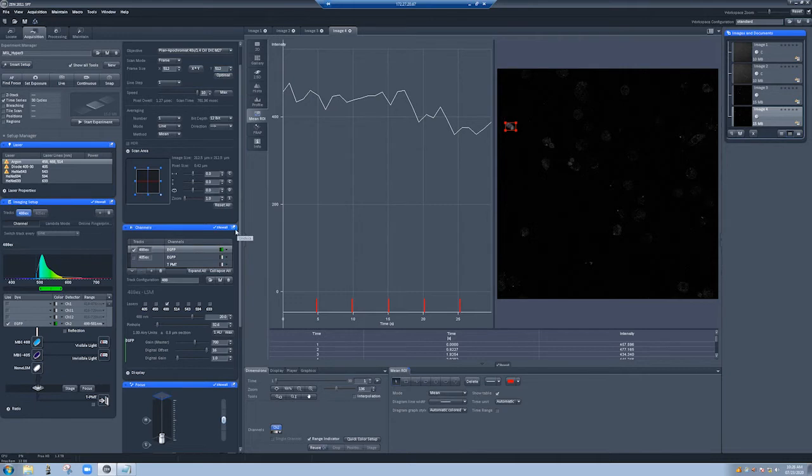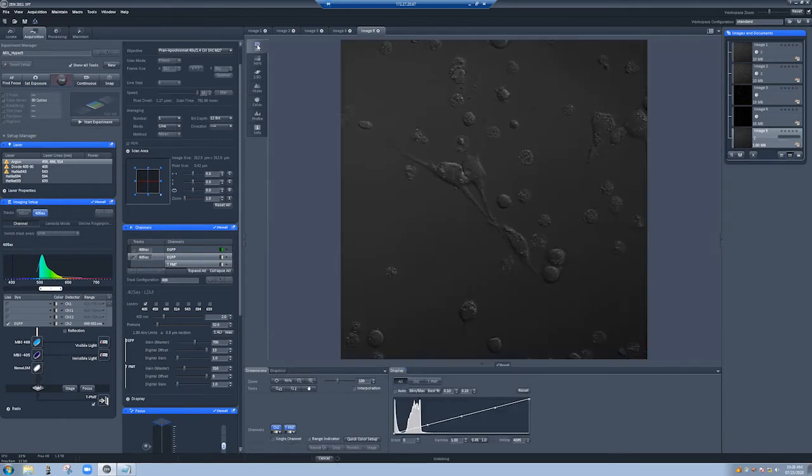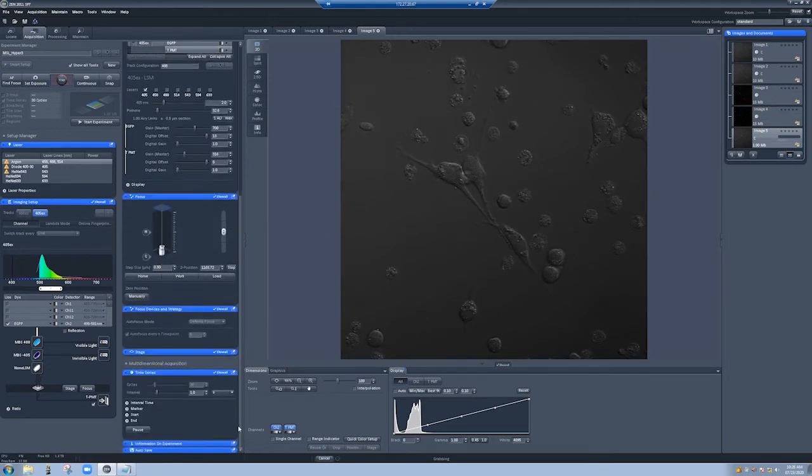So to do that, I'm going to switch back to this, just because I have a very nicely observable DIC image. Okay, so this is very clear. It actually looks nicely in focus. Because we're going to be moving around, I can't have a time series where the interval is so small. It won't give the system time to move around to different locations. So again, every time you add something to the experiment, there's a cost.